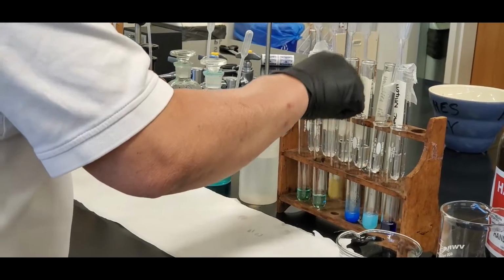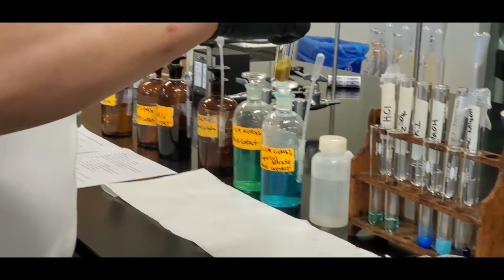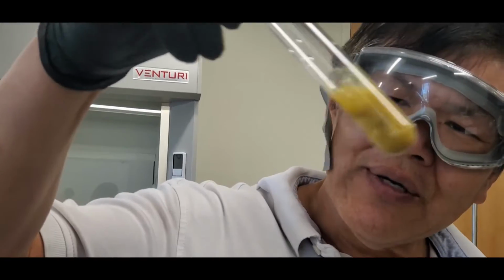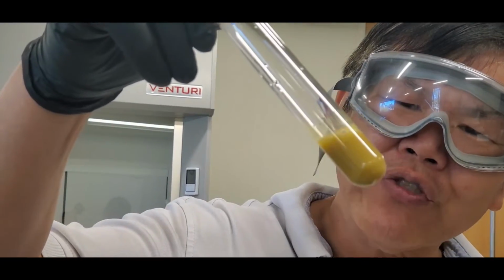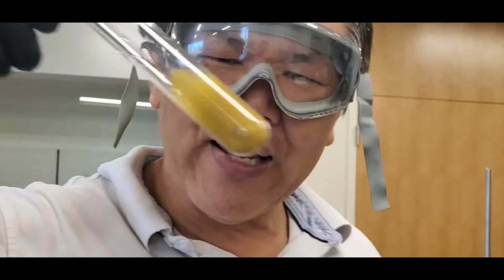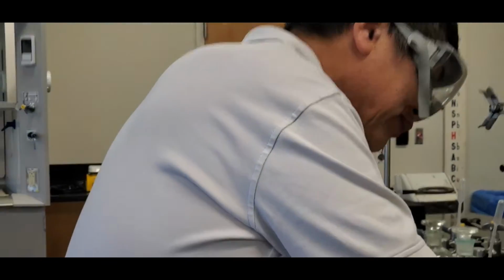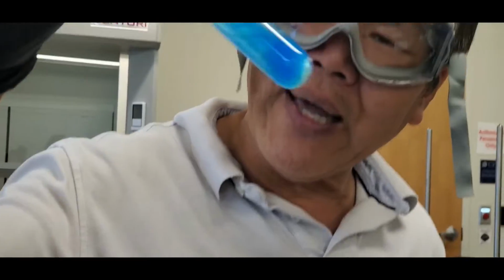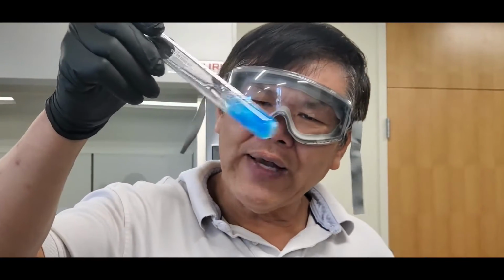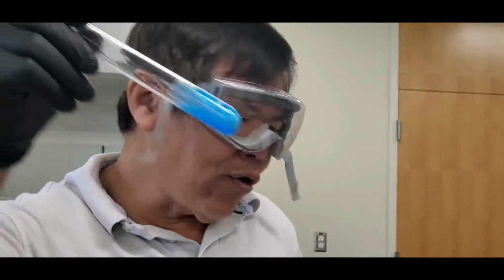This one's colorful, man. All right, what you got over here is this. The one with the potassium iodide and the copper looks kind of tannish. Now, after you centrifuge it out, the real stuff is kind of white, okay? But this got a lot of iodine in it. That's why it's looking like this. Now, the one with the sodium hydroxide, does that look like the copper lab that we did last semester? It's kind of a gel, yeah? That means it's slightly soluble.